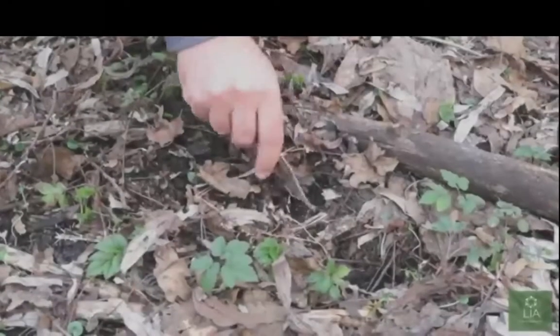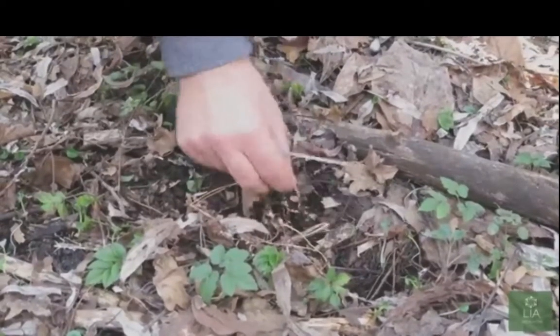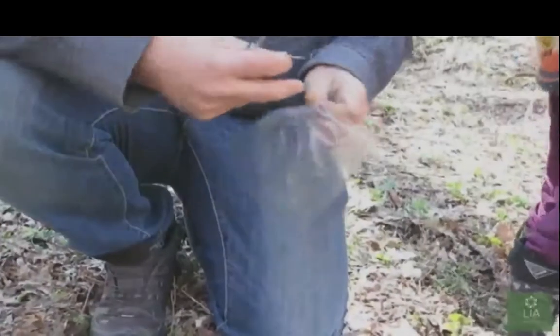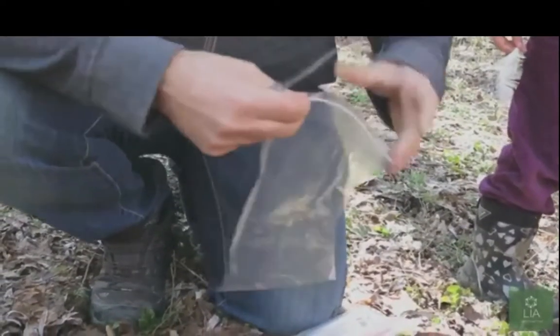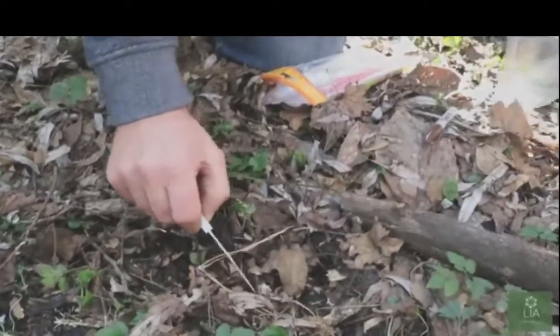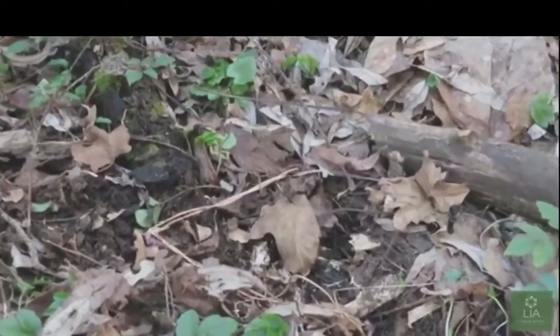Wait just a minute now. Hold on. Okay, here he goes. Sample. Now see, he's just grabbing that with his fingers. And I'm not growing mushrooms to eat or anything like that. Who knows, I could start a whole project. No, these are just the physical characteristics of the mycelium.